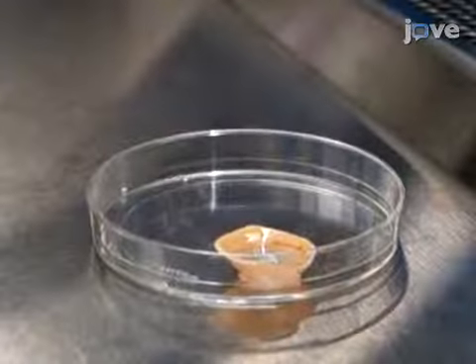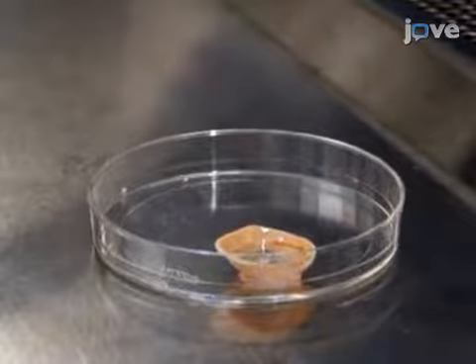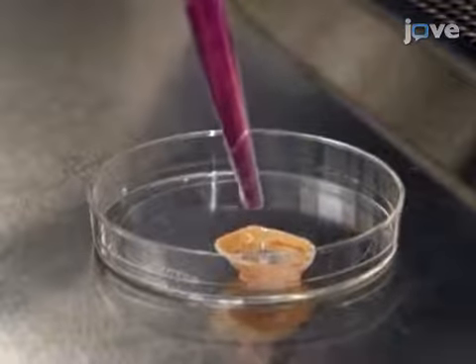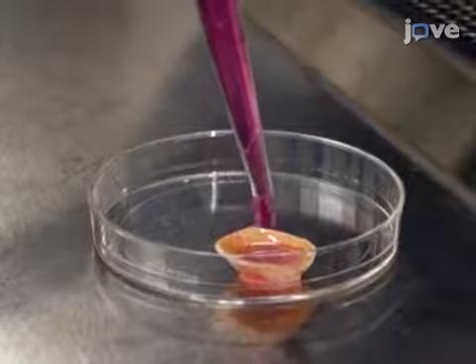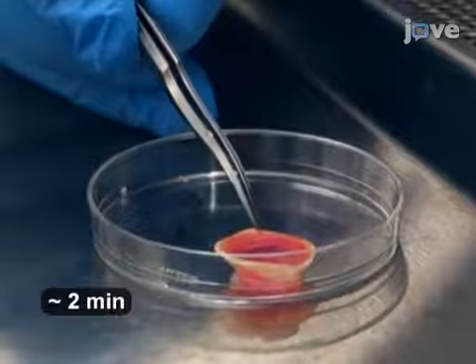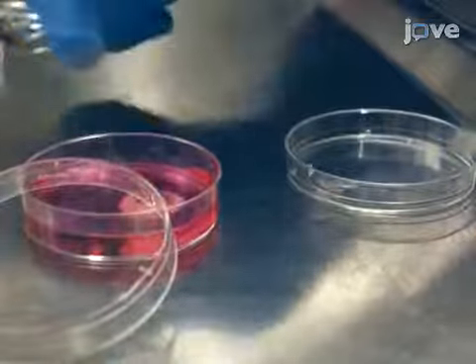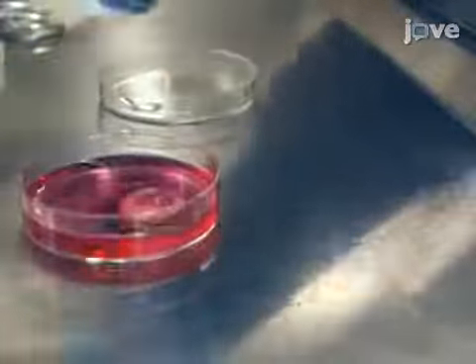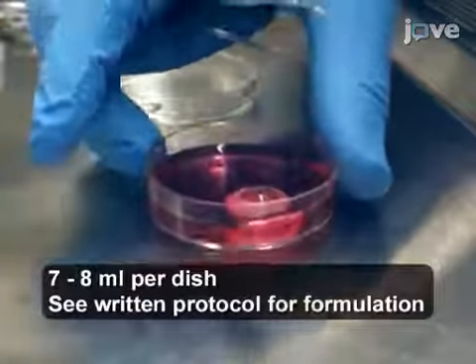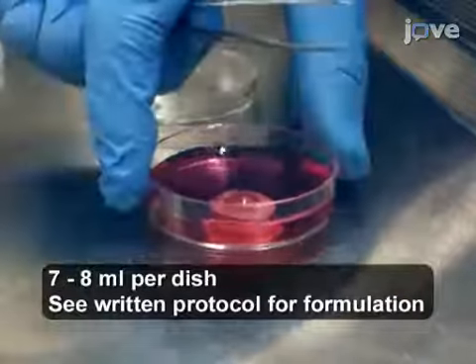Place the corneas epithelial side down in sterile 60 mm dishes and fill the concavity with 0.5 milliliters of agar collagen mixture. The mixture solidifies on the corneas within 2 minutes. Once solidified, place the corneas agar side down in sterile 60 mm dishes containing enough full supplemented medium to reach the level of the limbus for air-liquid interface culture.